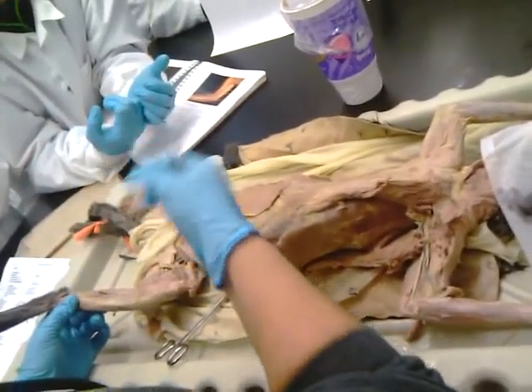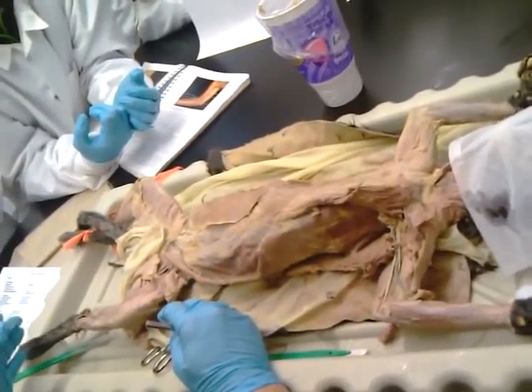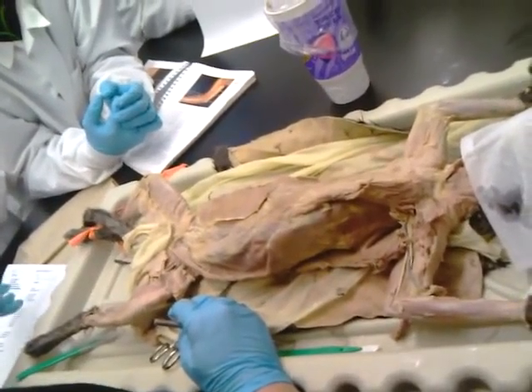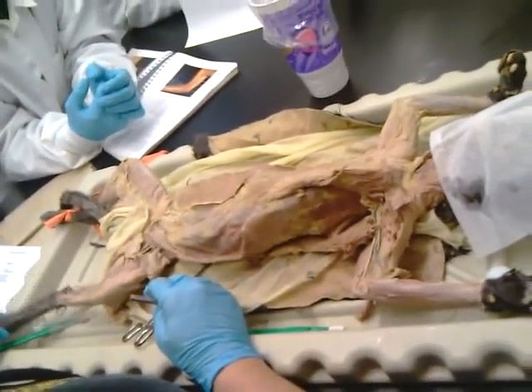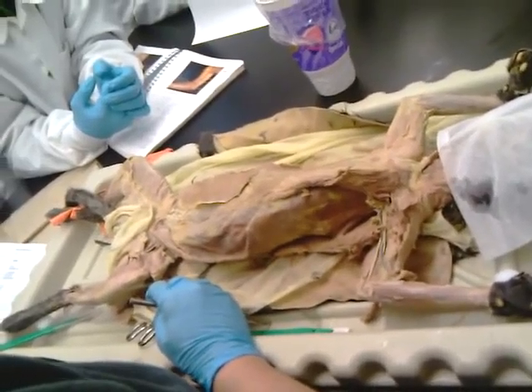Okay, so that's how I can use my list to help me out if I'm stumped. Hopefully in your head you say, okay, and you're going to have this exact same list. So I'll know this upper part is the head and neck, this is my leg and my arm. I know that's leg, hopefully, by now, so I know it has to be down here.